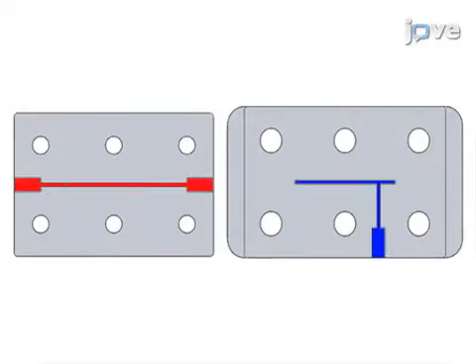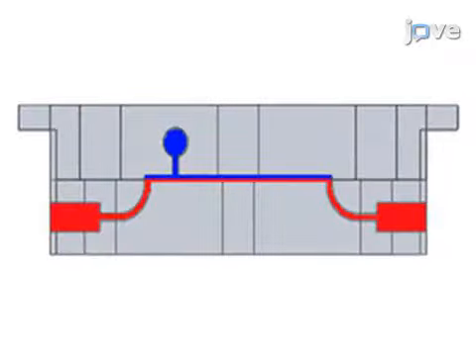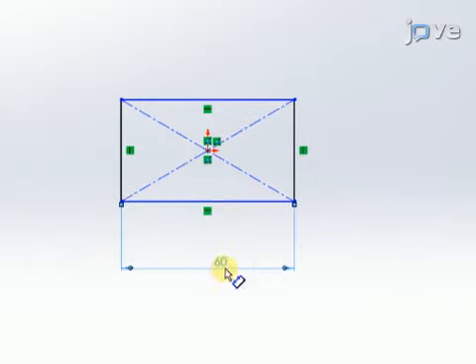Begin by designing the microfluidic device in 2 separate parts using a computer-aided drafting program. To make the bottom layer, use the rectangle tool to draw a 40 mm by 60 mm rectangle.